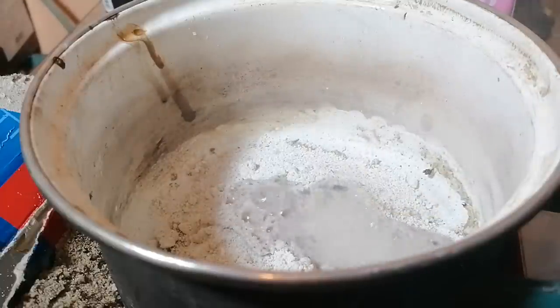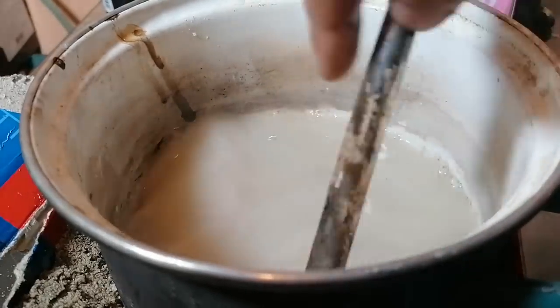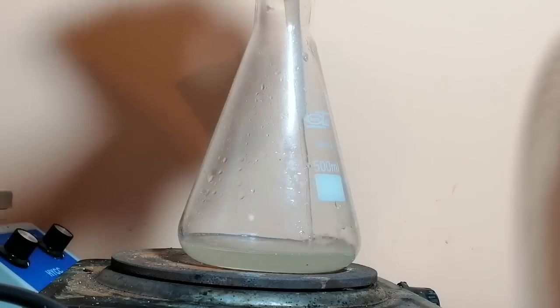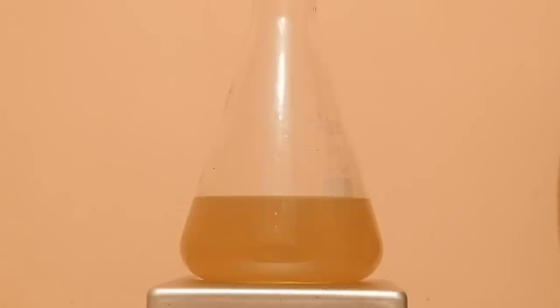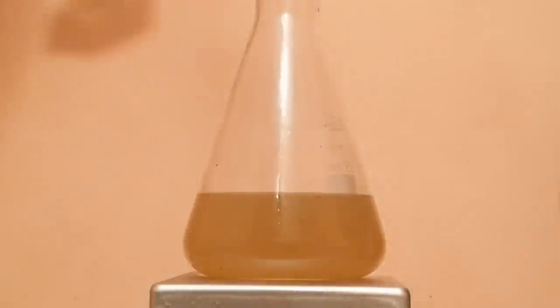I've added a bunch of water to dissolve the silicate. After that, I filtered everything, and the worst had happened — the filter was getting clogged and I had to constantly swap it out. After three hours of psychological torture, we were left with a bunch of orange solution, which is definitely not pure. Here's the exciting part: the neutralization of all the excess base and turning sodium silicate into silicic acid to purify and extract the silicon source.